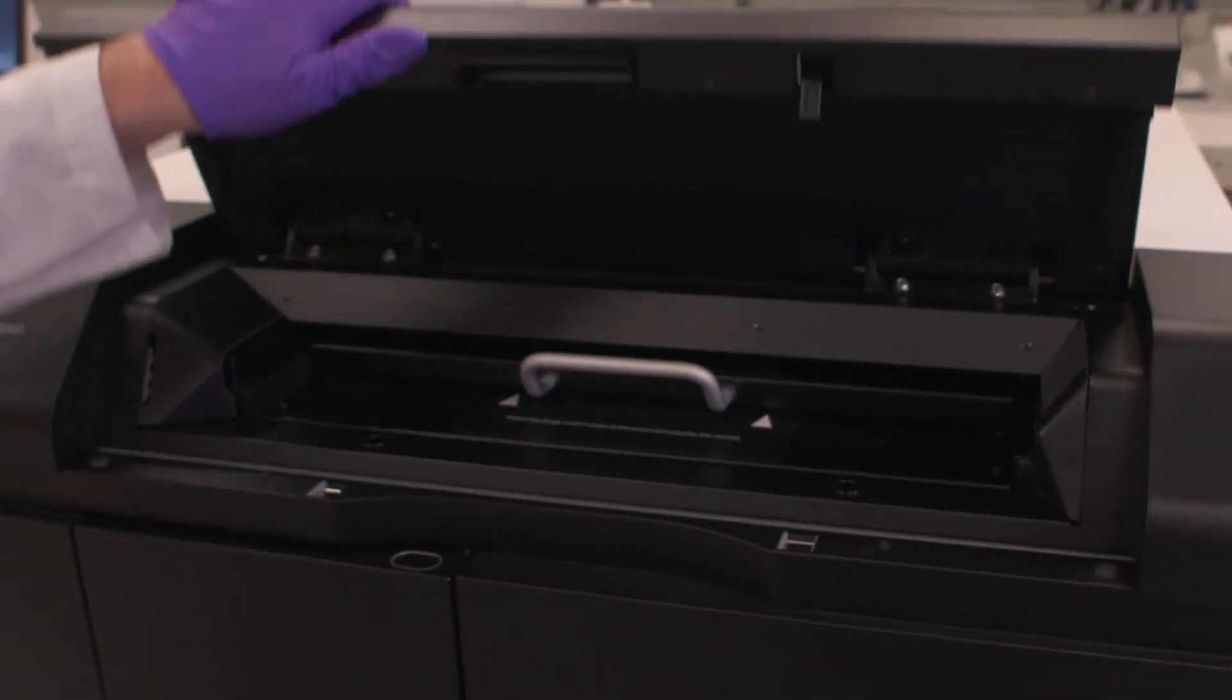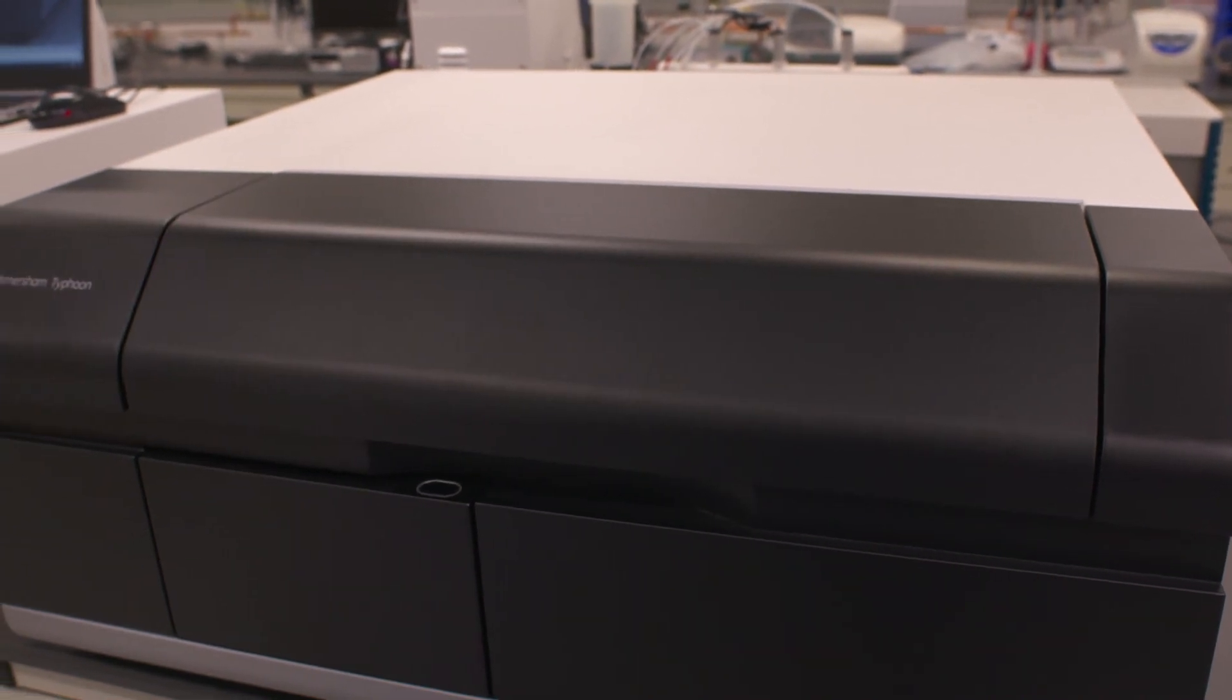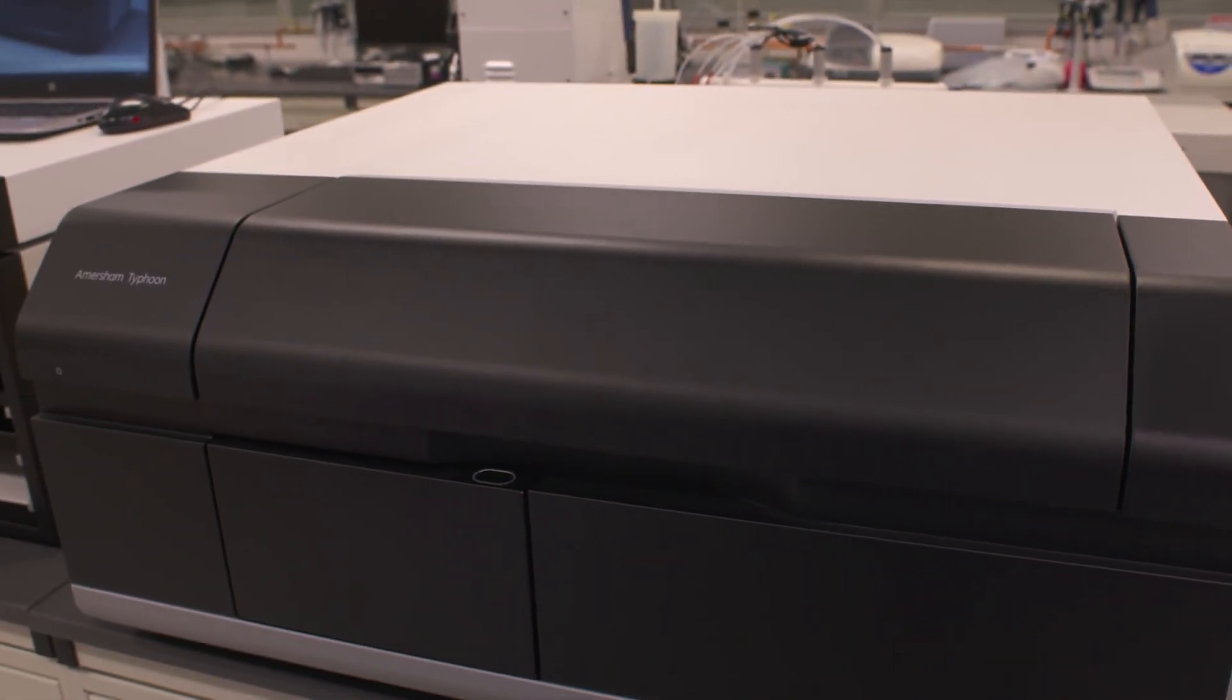Then we're going to take the lid, lock that in the machine, and now we're just going to set up as we normally would, just using that phosphor module to set up for a storage phosphor scan.